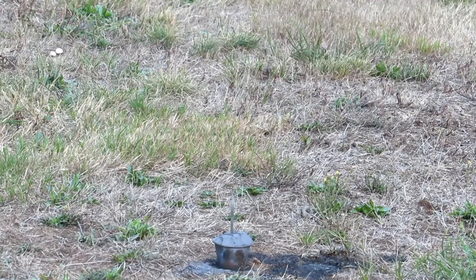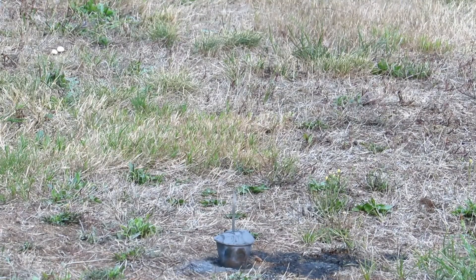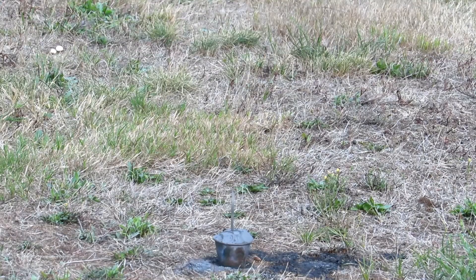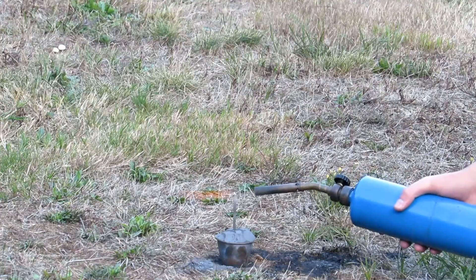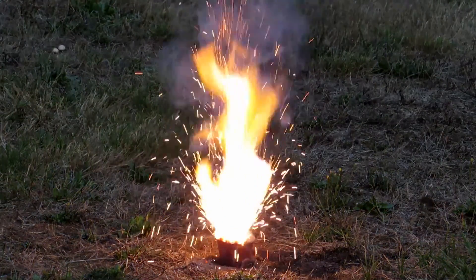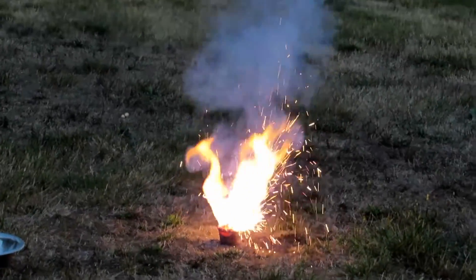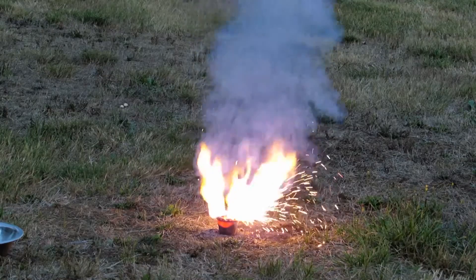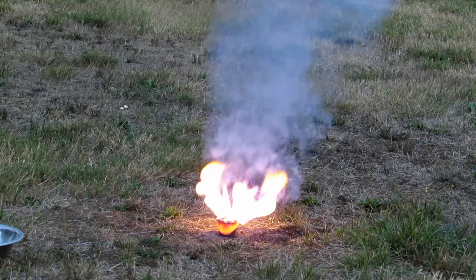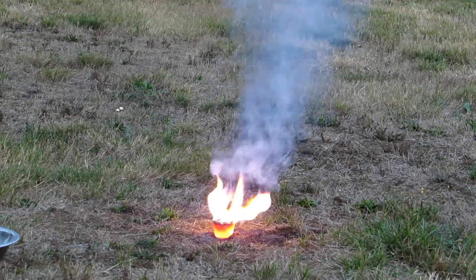It's ground up, put in another crucible, and I'm expecting this reaction to go much much faster, be much much hotter, and smell much much worse — because we will be producing aluminum sulfide and possibly sulfur dioxide gas as the sulfur reacts with oxygen in the air. Now sulfur dioxide is poisonous, so do be careful. And much more energetic as you can clearly see — the flames are about a foot high, sparks flying everywhere. You can see it is propagating through the mixture much much faster. I'm really hoping we're going to get some silicon metal this time.